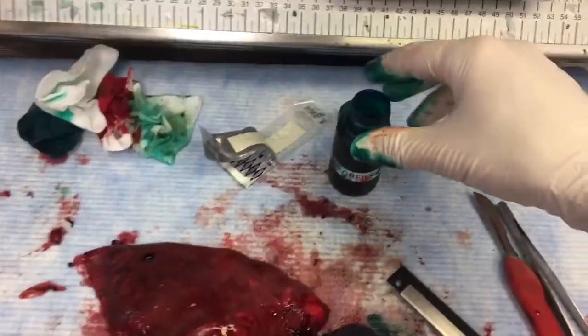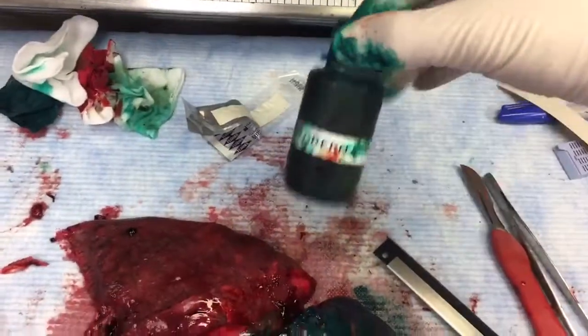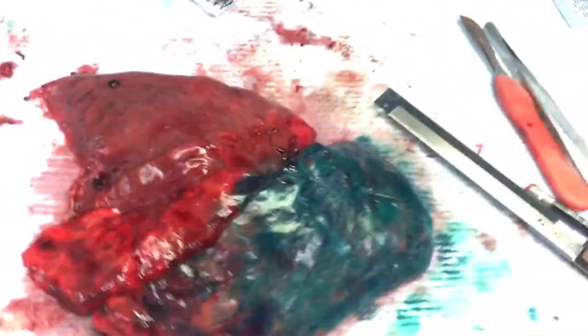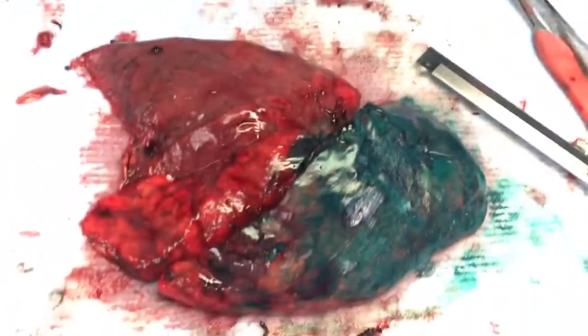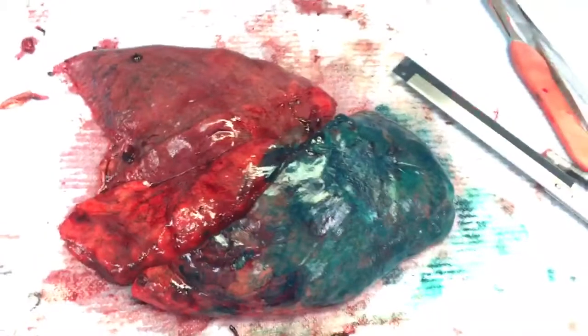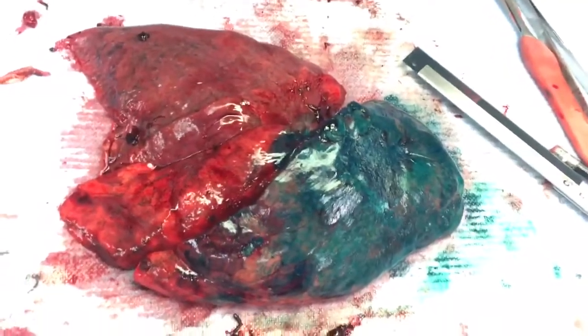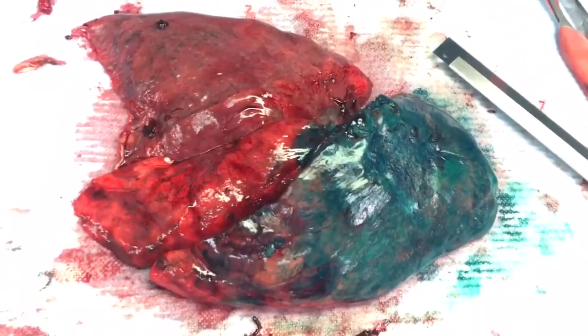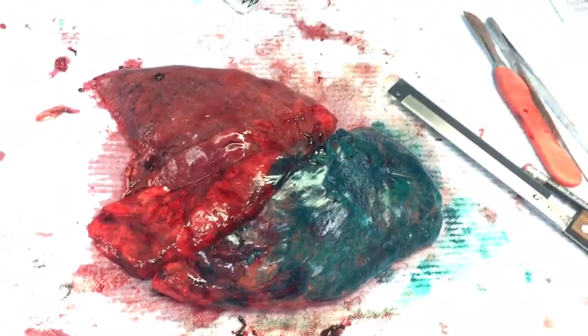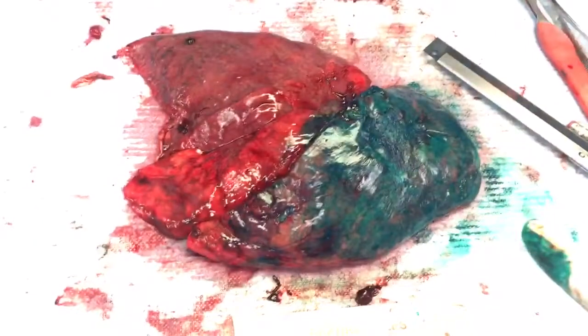I've got green ink on it. This kind of helped when we were looking under the scope, and it helps us to see where the pleural surface is. You don't really need it, though, because we can do special stains. One is specially called an elastin stain. The point is, I've got green ink on this lung.